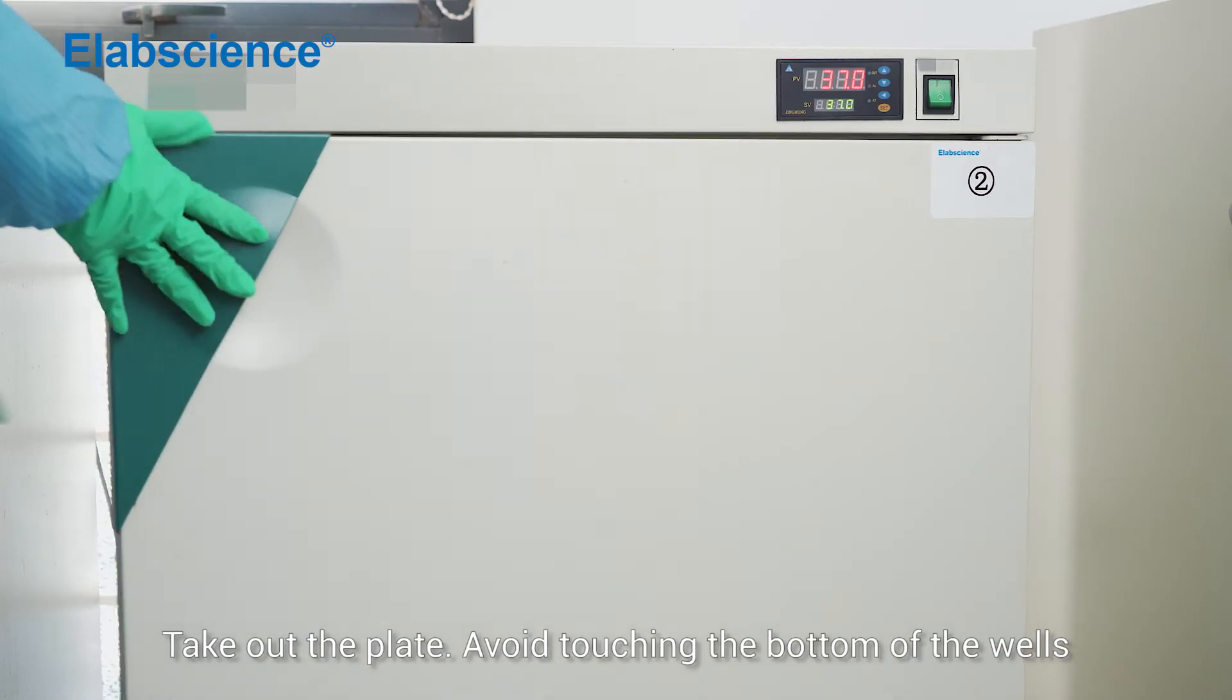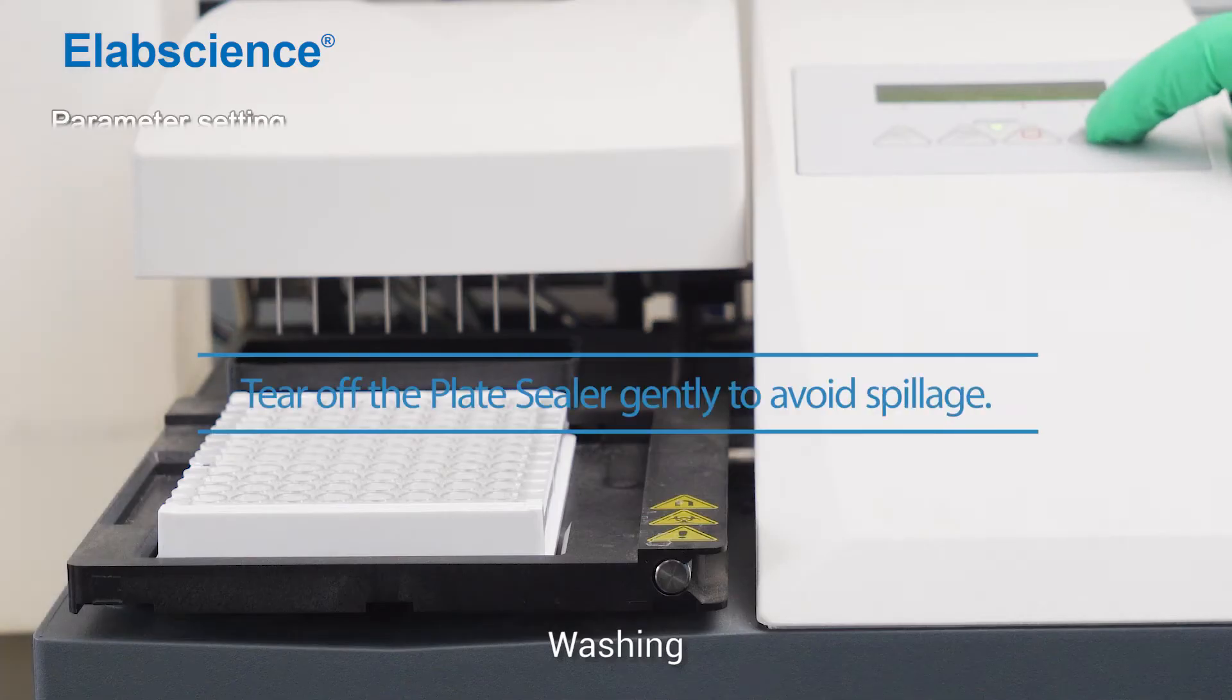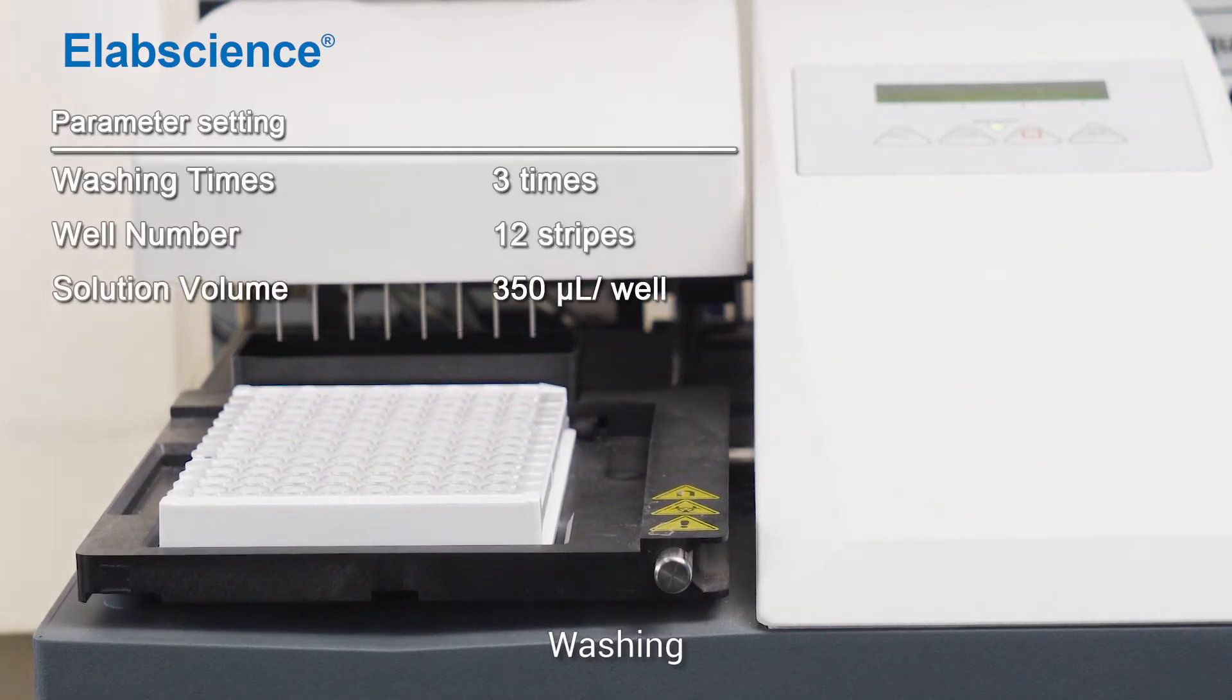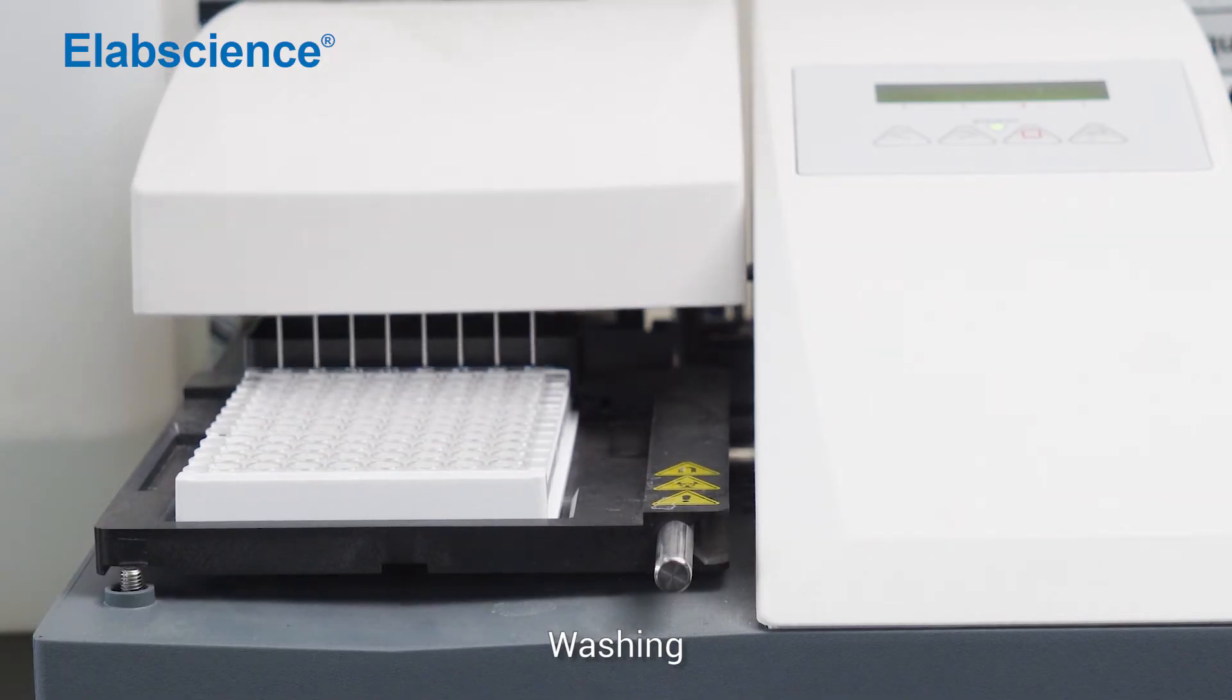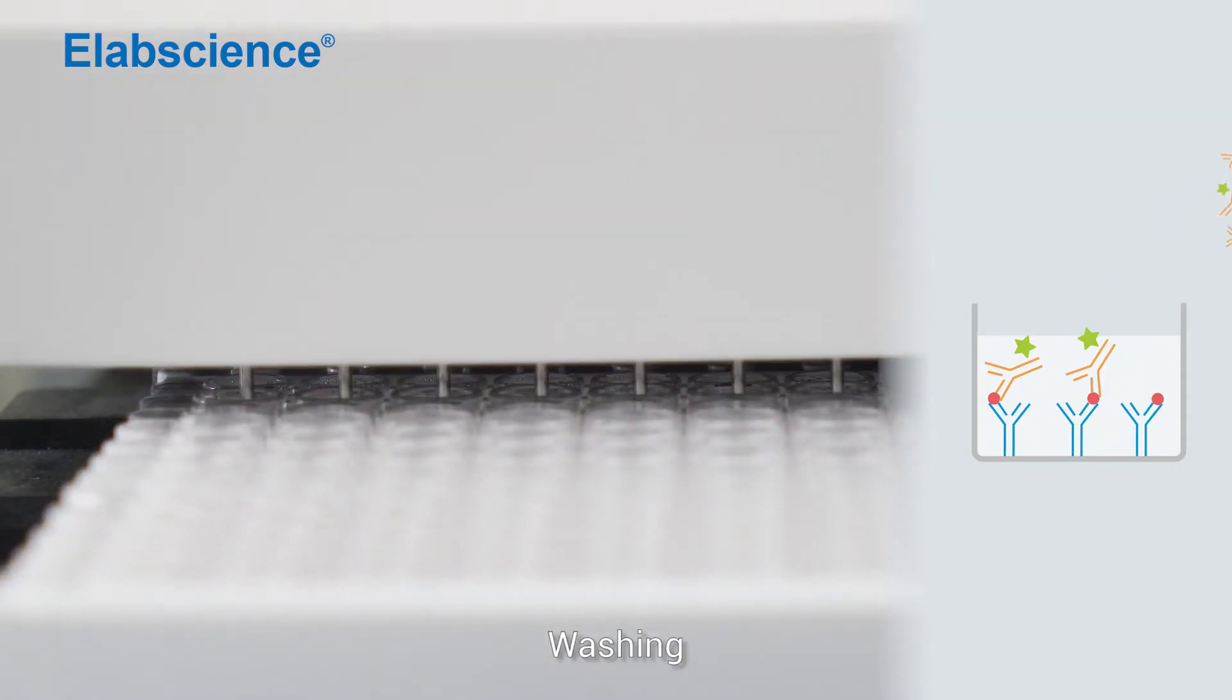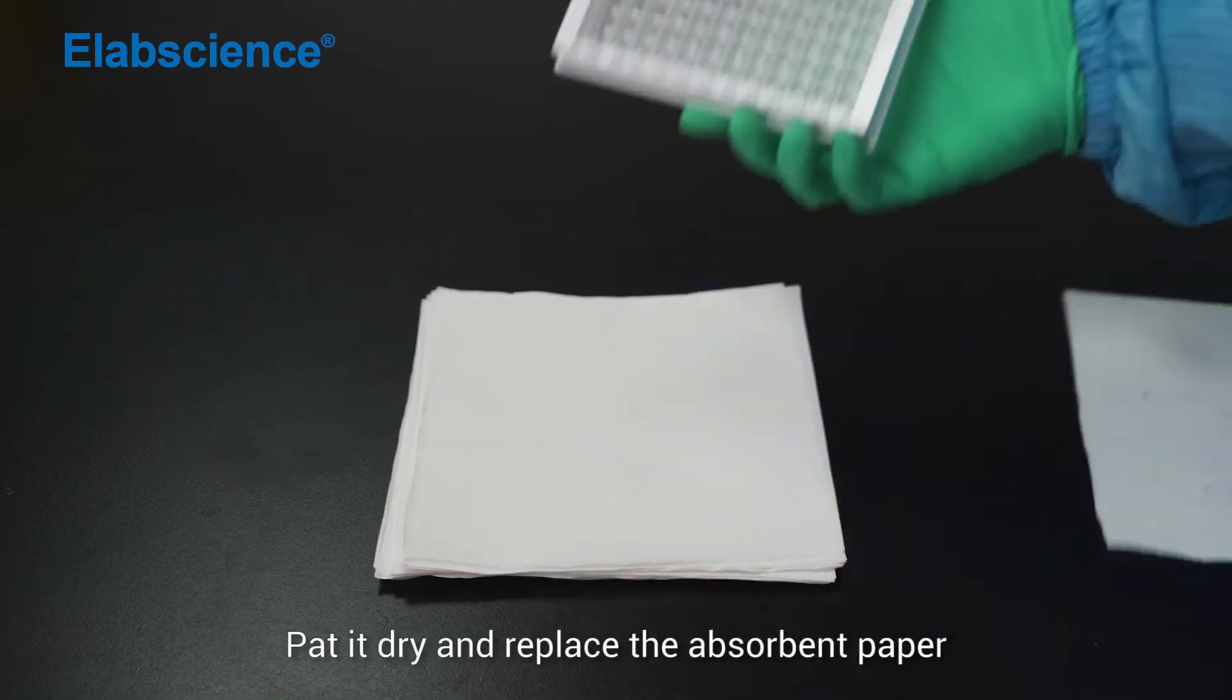Take out the plate. Avoid touching the bottom of the wells. Wash and dry the plate. Replace the absorbent paper.